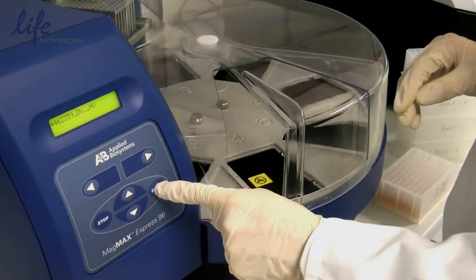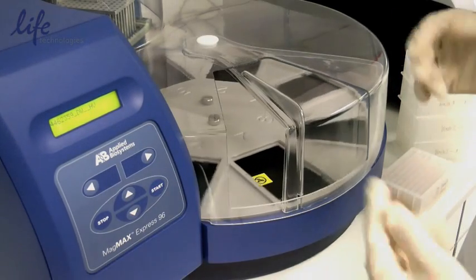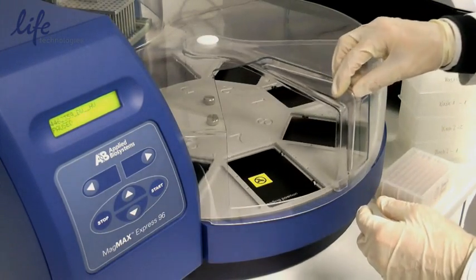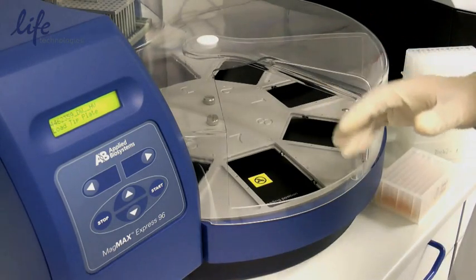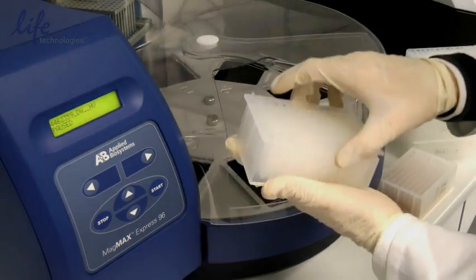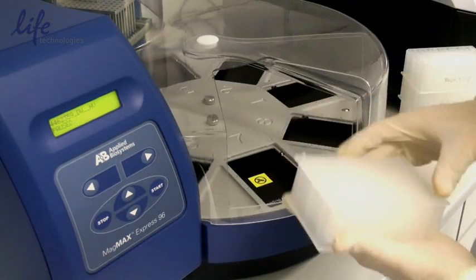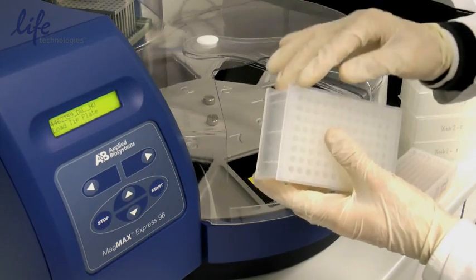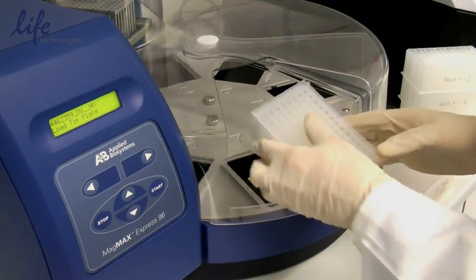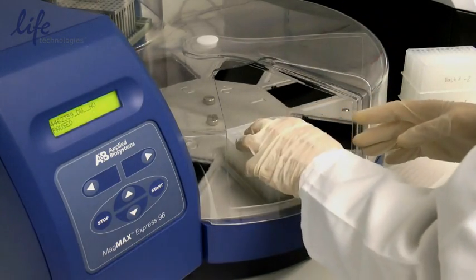We just need to press start. The instrument then guides us through what to load and at what time. The first one is the tip plates, so the tips just go inside. This plate is just going to be a holder. We need to take care of the A1 position and match the A1 position on the plate and that's it.